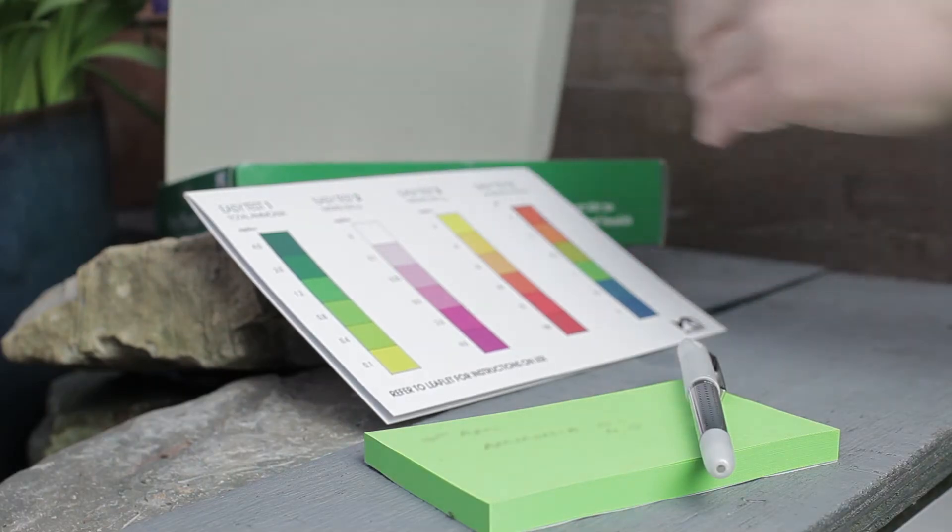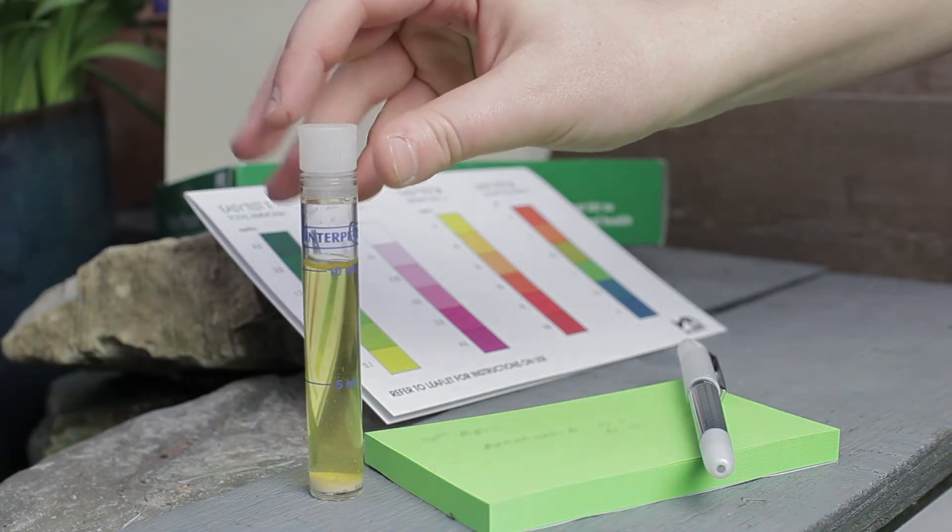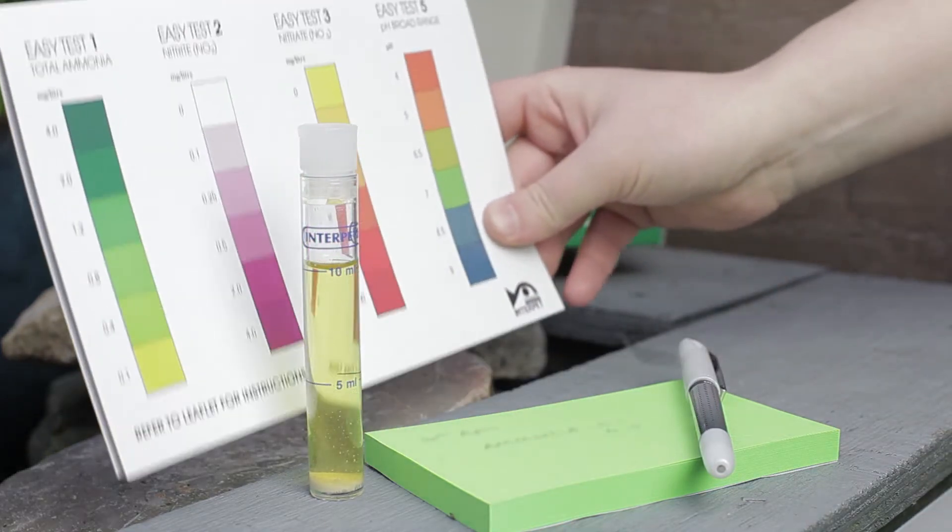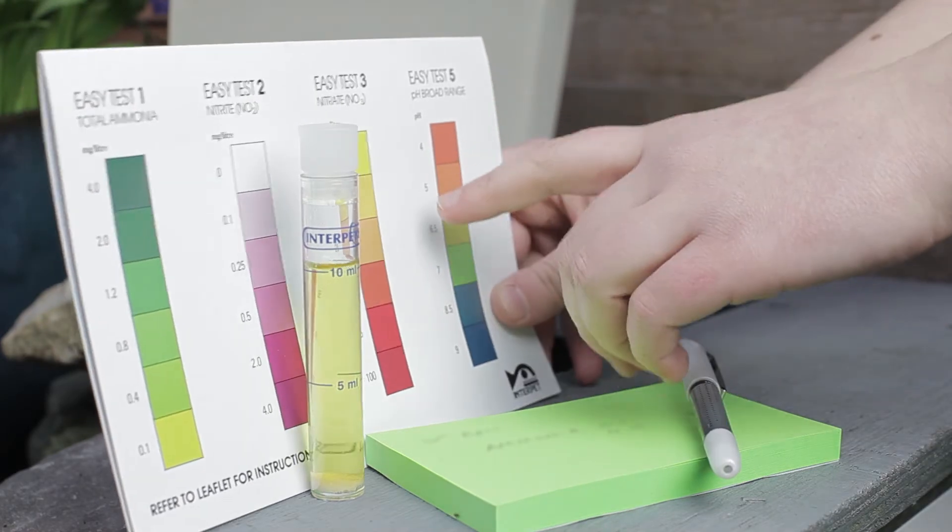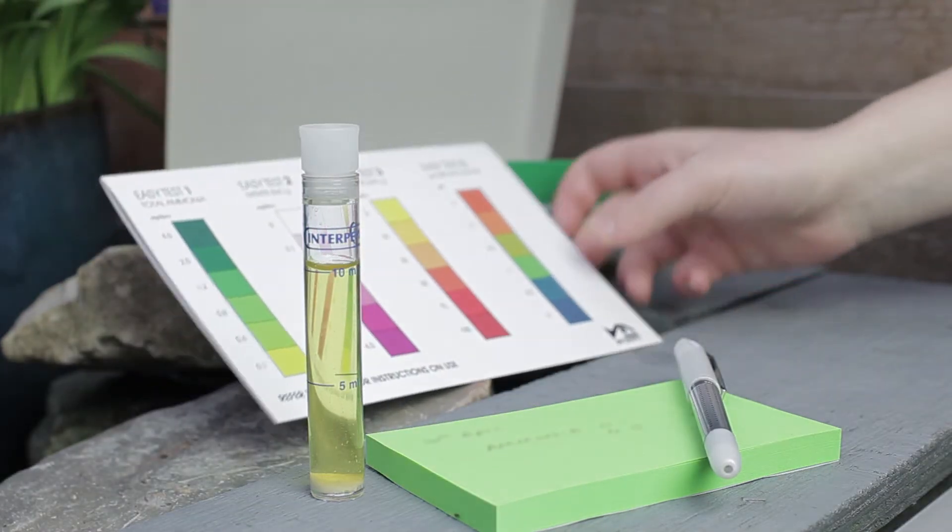Compare your developed test to the color charts provided and record your results to refer to later on. If you are concerned about your test results please visit the website for further advice.